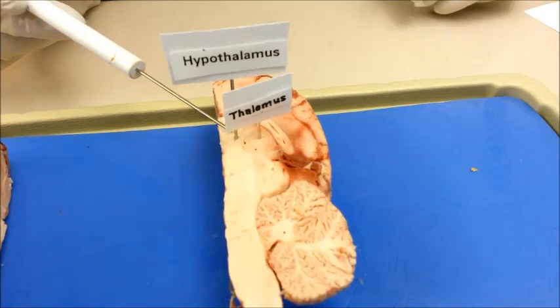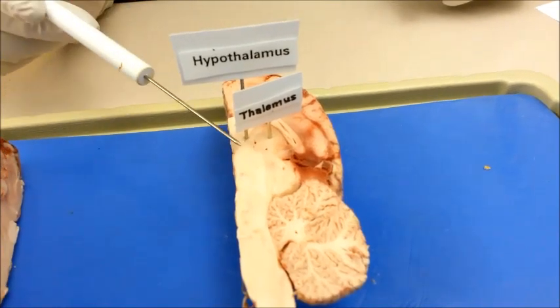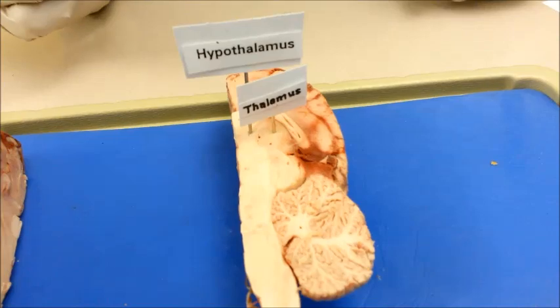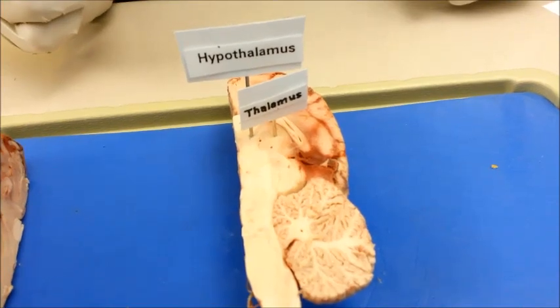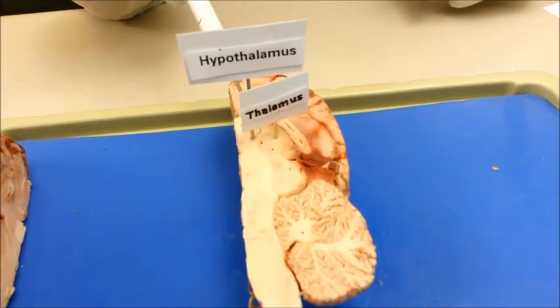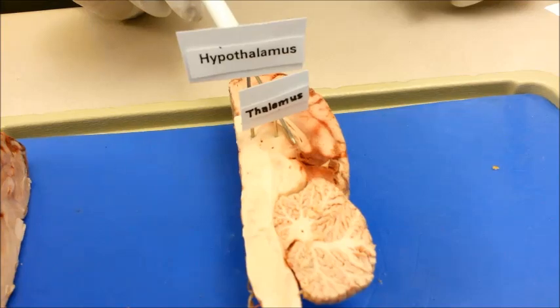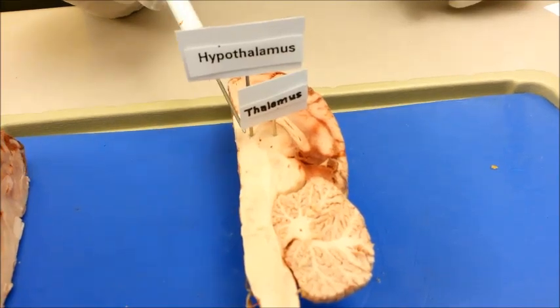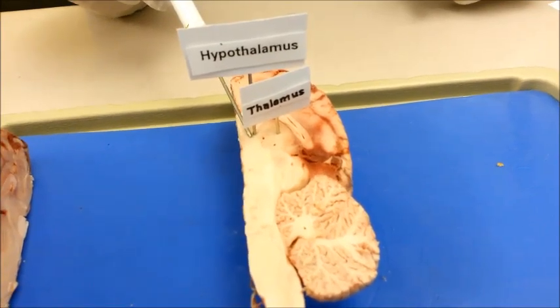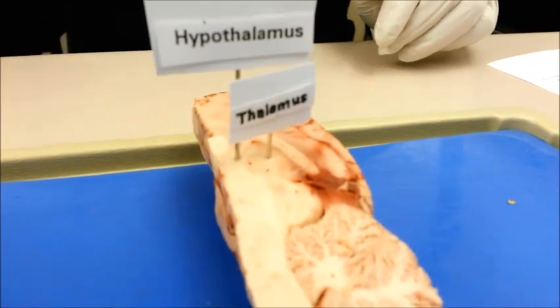The hypothalamus, located below the thalamus, manages hunger, thirst, body temperature, and other involuntary functions. The thalamus sends information to the cortex in response to the cerebellum and medulla. It is partly responsible for the regulation of sleep and waking up. If damaged, it may lead to a coma.